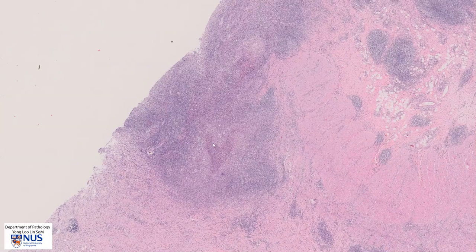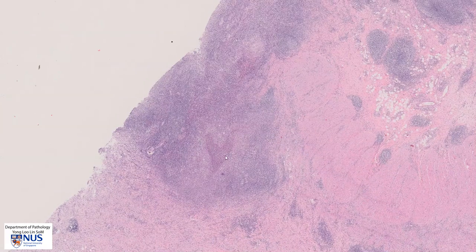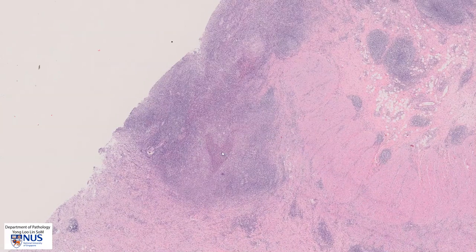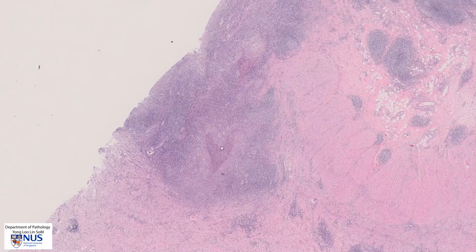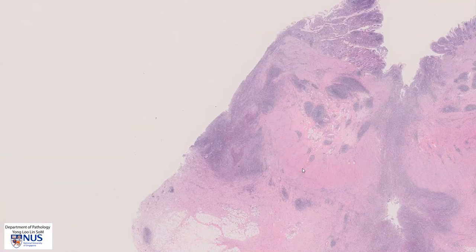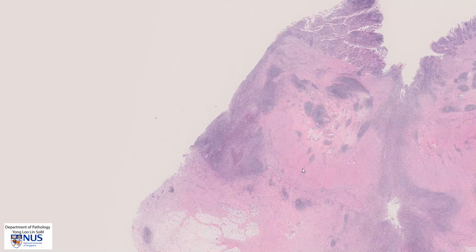Here is another part of an ulcer that is partially sampled, and again we can see this acute inflammation within the ulcerated area. Let's take a look at some small biopsies.